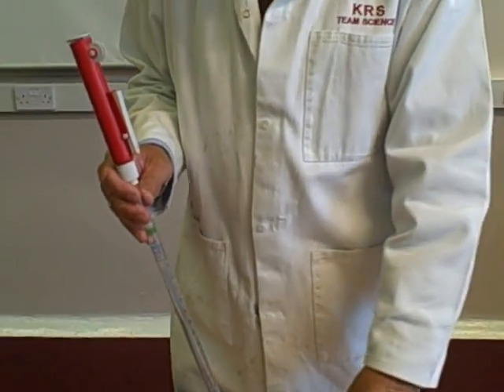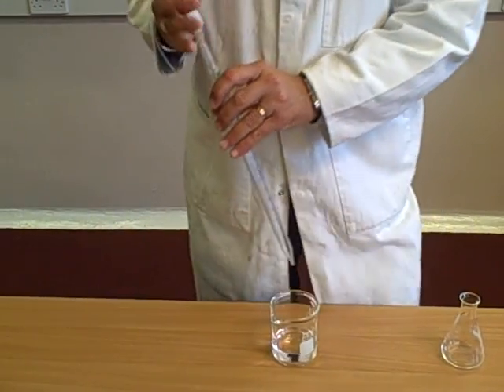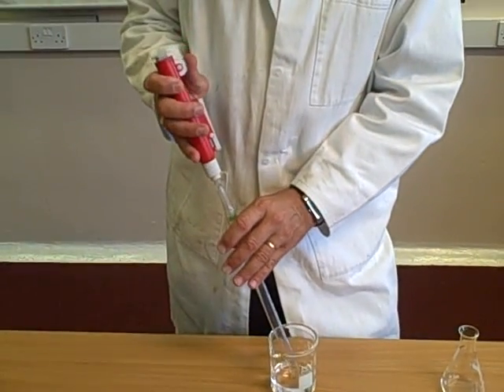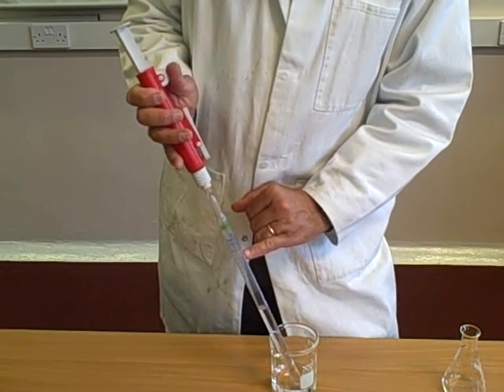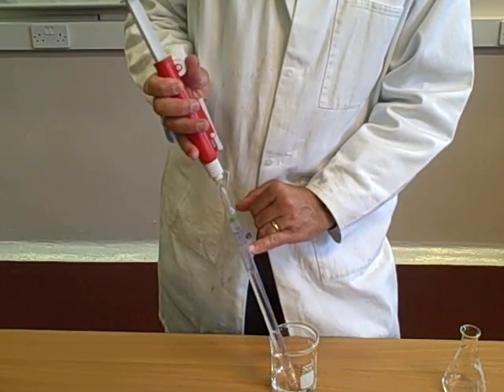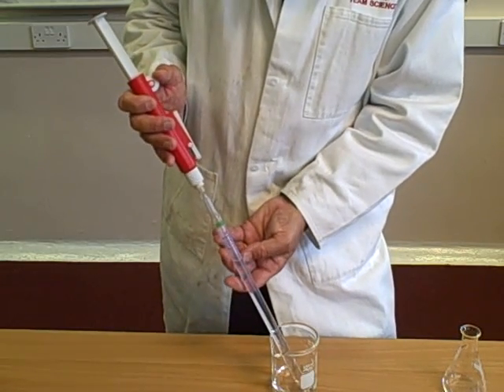We have some sodium hydroxide in this beaker here. What we're going to do is we're going to fill this until I get to the 0 line. I take this up. As you can see, I've stopped short.